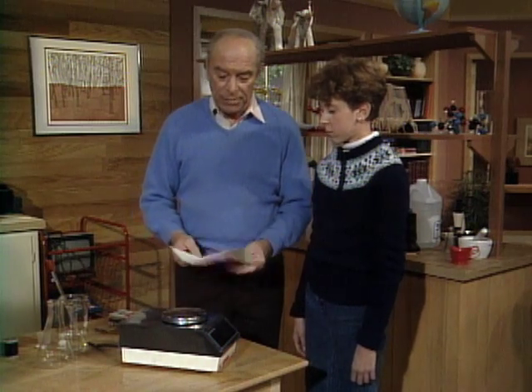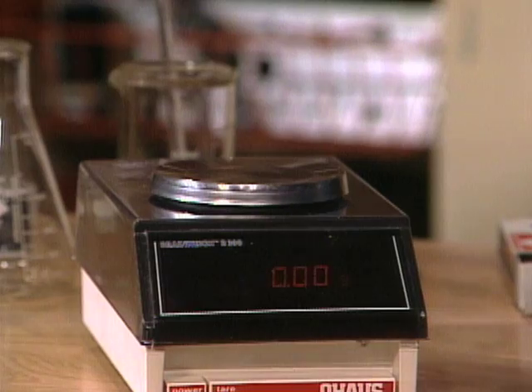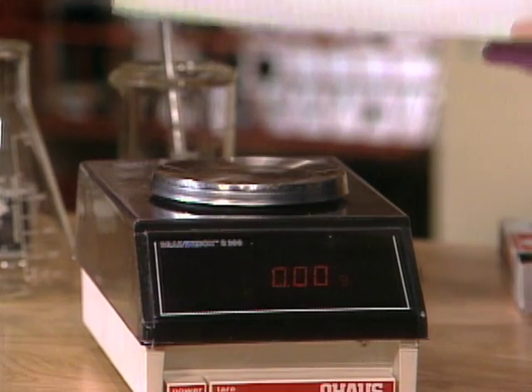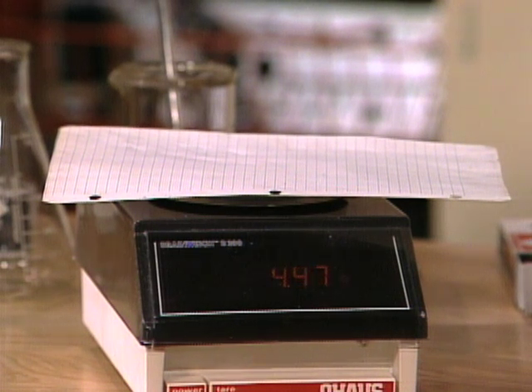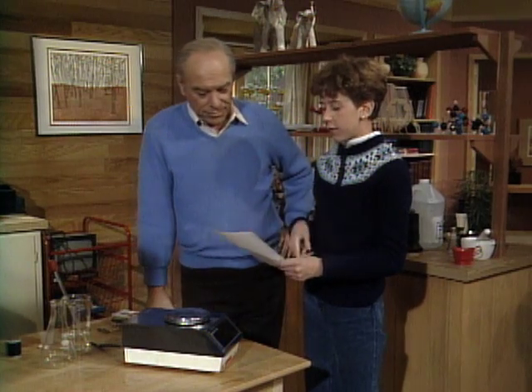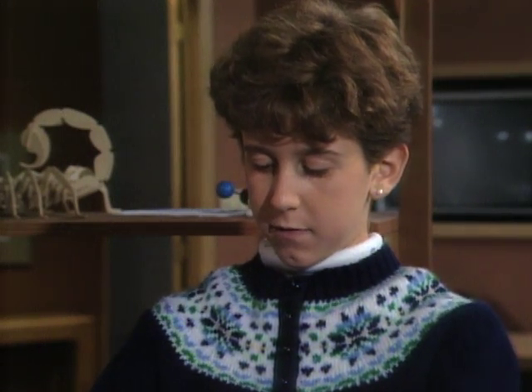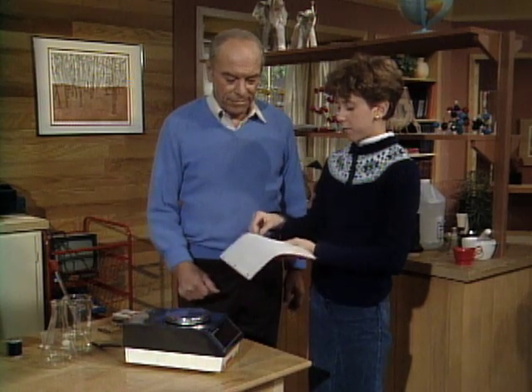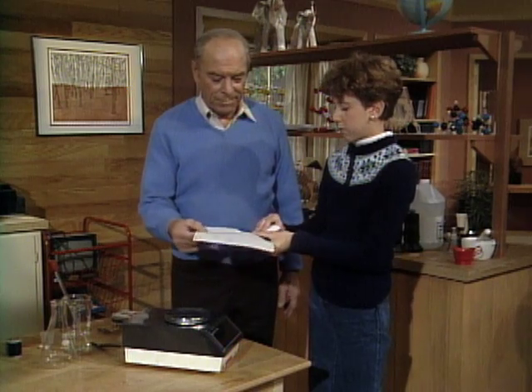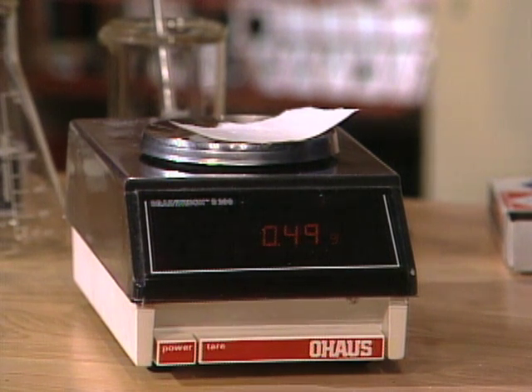So I thought I'd give you a little problem. Here is a piece of paper — would you tell me how much it weighs? Zero it first. It weighs about 4.532 grams. Now I'd like you to tear off a piece that weighs about half a gram. So it weighed about four, so I'll have to divide it into about eight sections. See how close you came — 0.48, 0.49. That's pretty close. Very close indeed. That was a good guess.